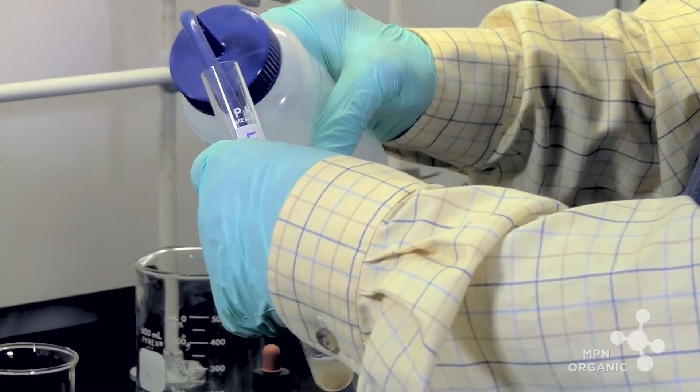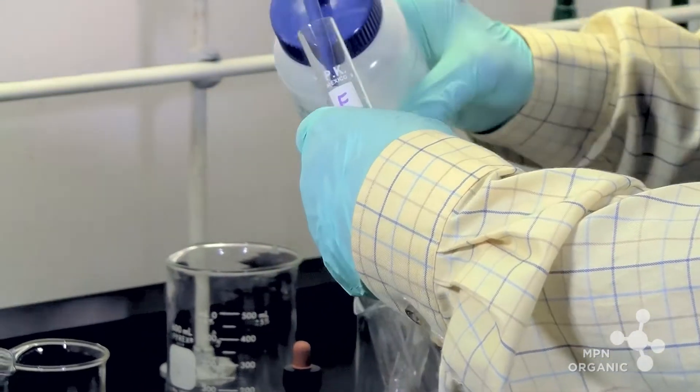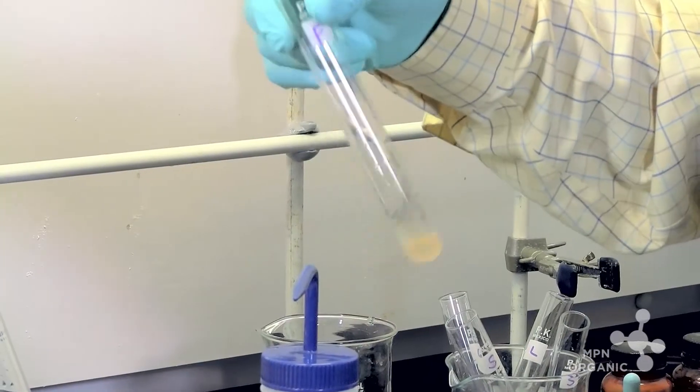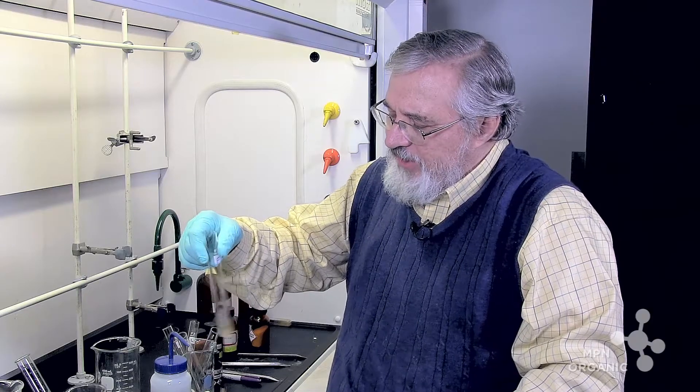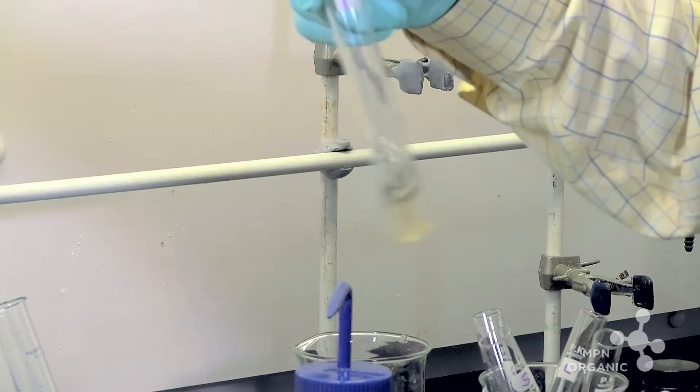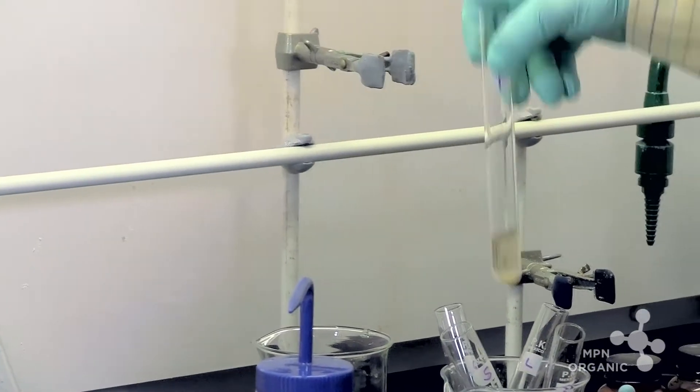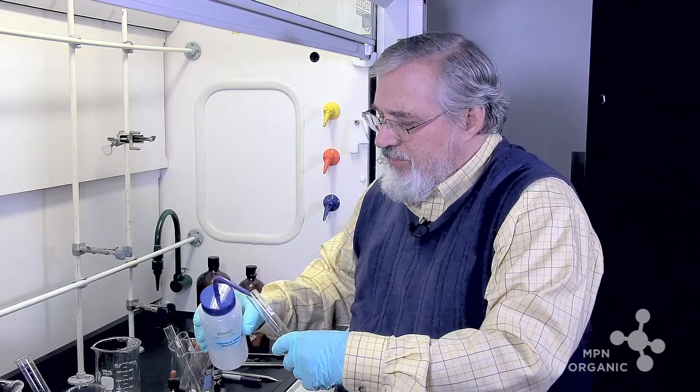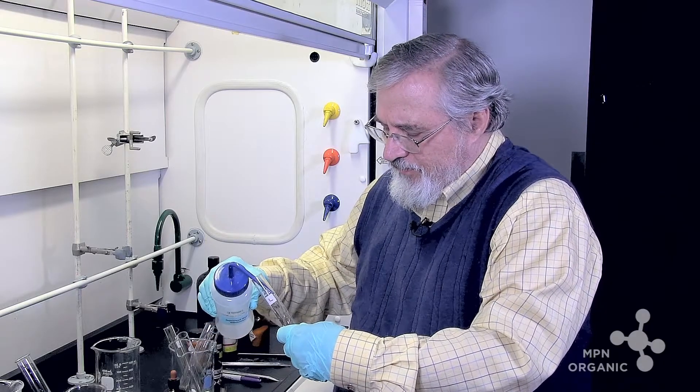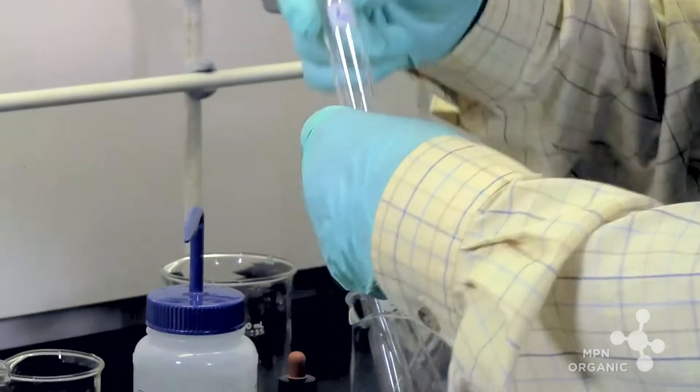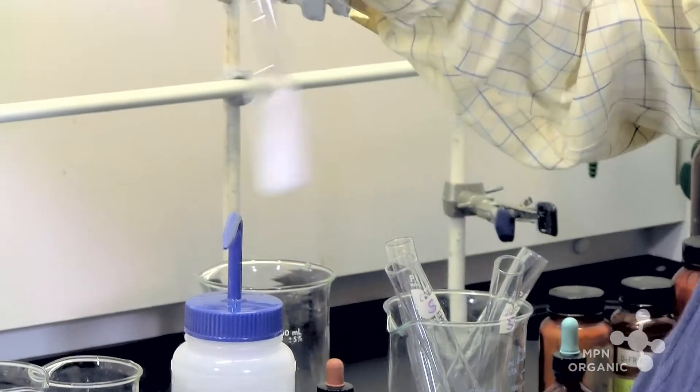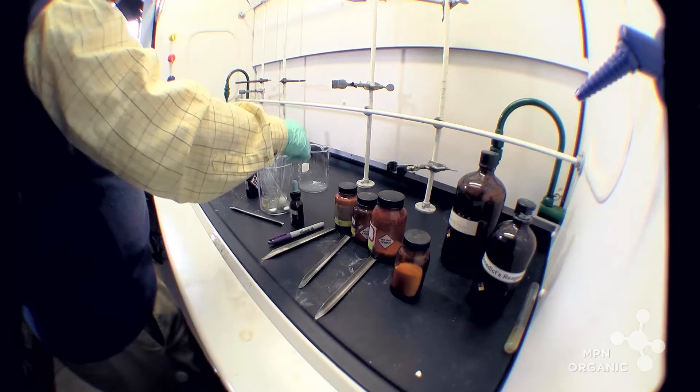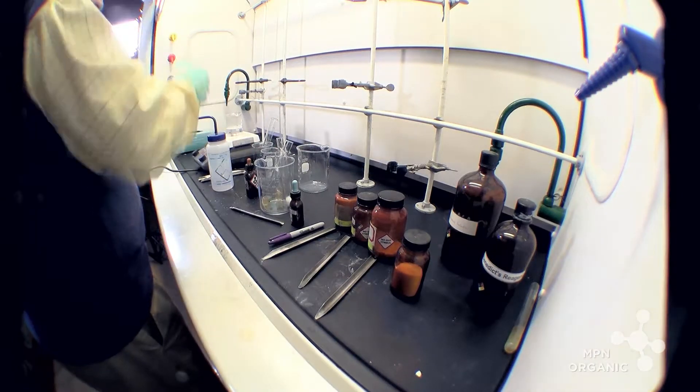Now fructose is not like these others in that it is a keto-hexose - in other words it has a ketone rather than an aldehyde. And then lactose, it's not quite as soluble. And then our two solutions of sucrose.